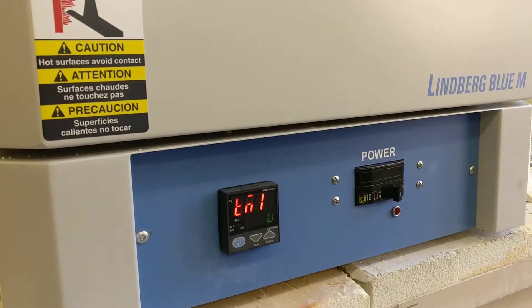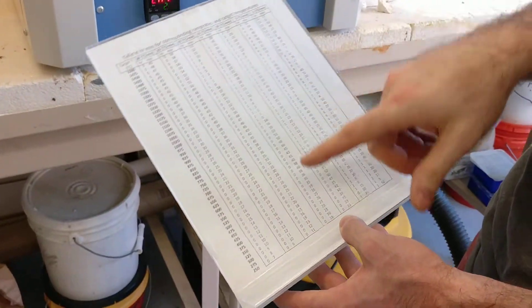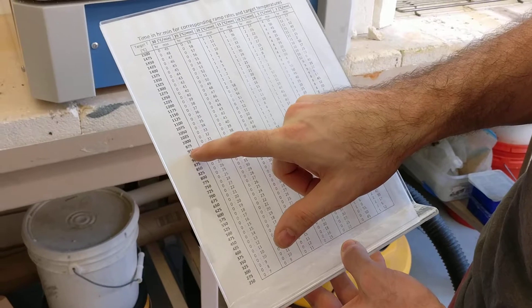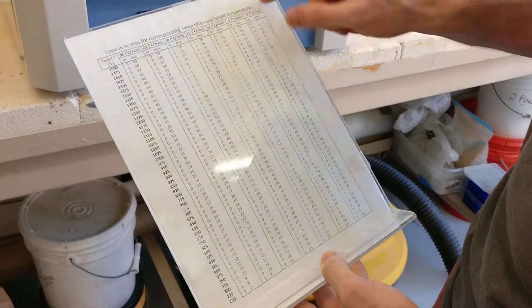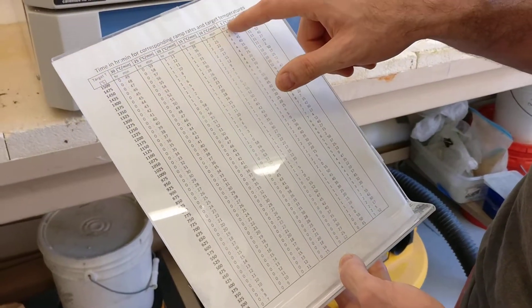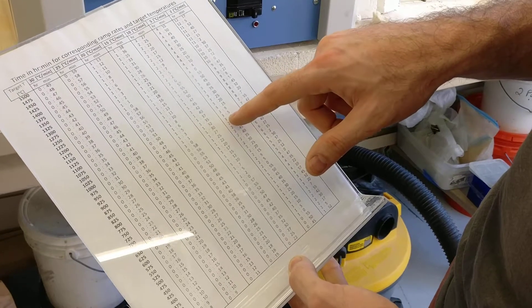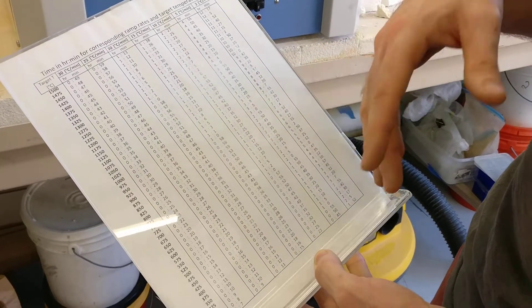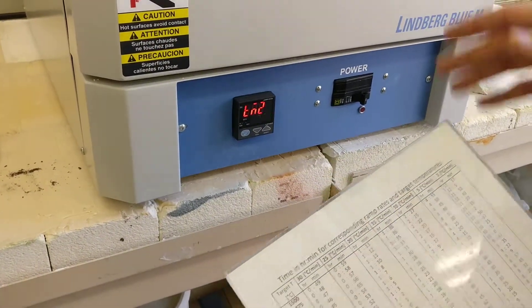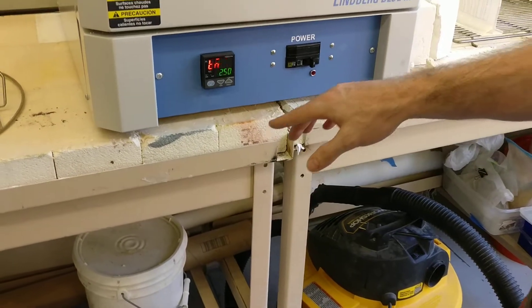This time one is the time it takes to get to that set point. We have this handy sheet which says: what's your target set point? Ours is 950. And what's your ramp rate across the columns? So if I want to do it slow — 5°C a minute — and I want to go to 950, I just read across, and maybe it takes three hours and five minutes to get there. Then I would just put that in as the time value.